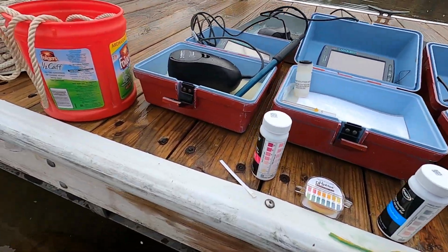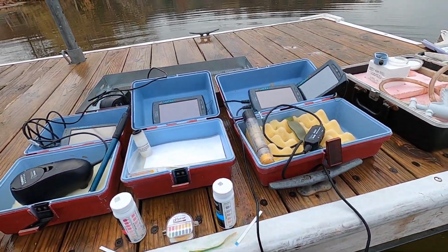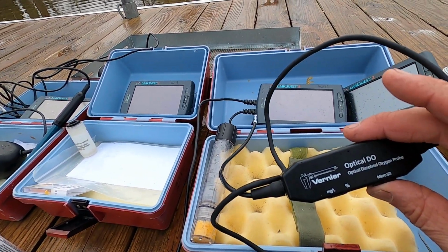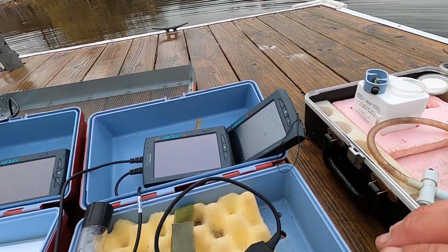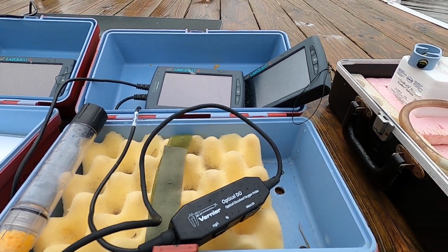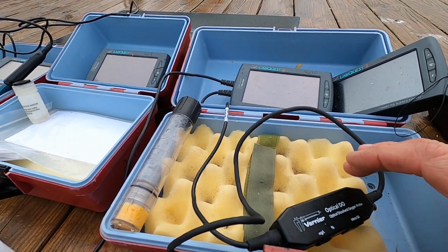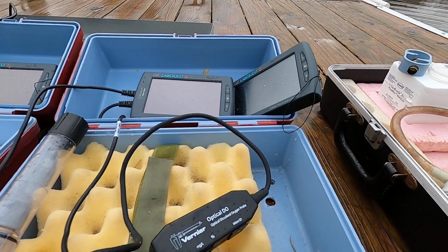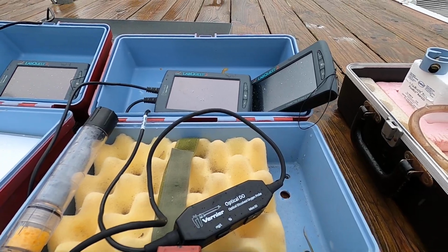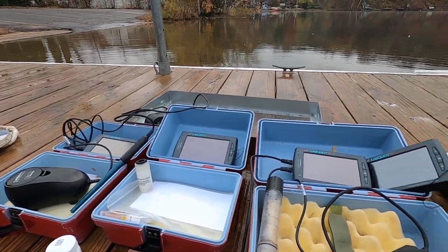And then we have dissolved oxygen. So this is a dissolved oxygen probe, and it's been sitting in the water, and it runs its information. What's kind of neat is I have a switcher. I can either read in parts per million or I can read in milligrams per liter. And we got a dissolved oxygen of 11 parts per million, which is fantastic. It's also a little artificial because it's so cold out. The water is cold, it easily holds more dissolved oxygen. But with one flip of the switch, I can go to percent saturation, and I'm sure the saturation level will be over 90% saturated. The water is pretty much full of dissolved oxygen. And so those are some of the parameters that we've measured here, which is a pretty grand array.